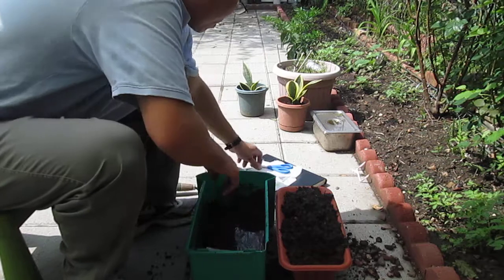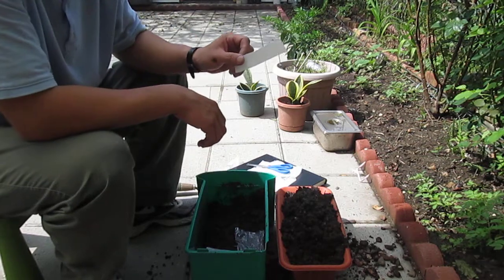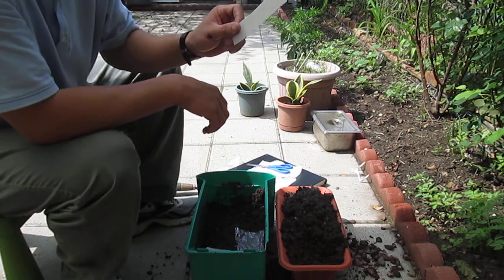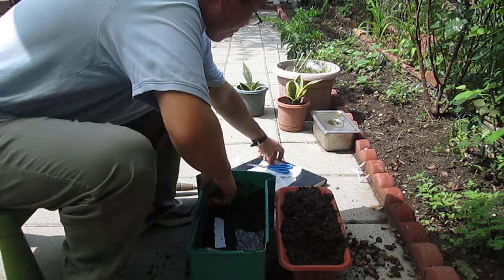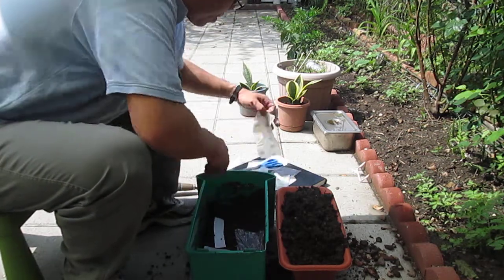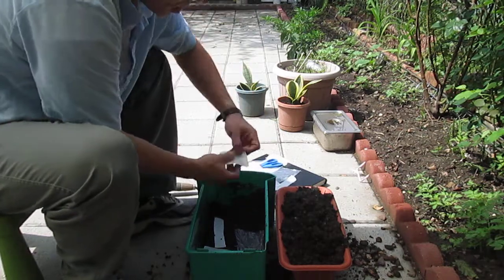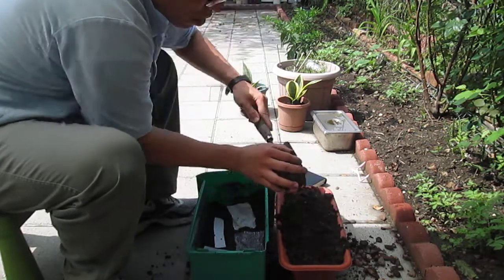Put the film in. This one is 50% PLA and 50% PBSA. Now we have different things — this is diaper film. So we cover it as well.